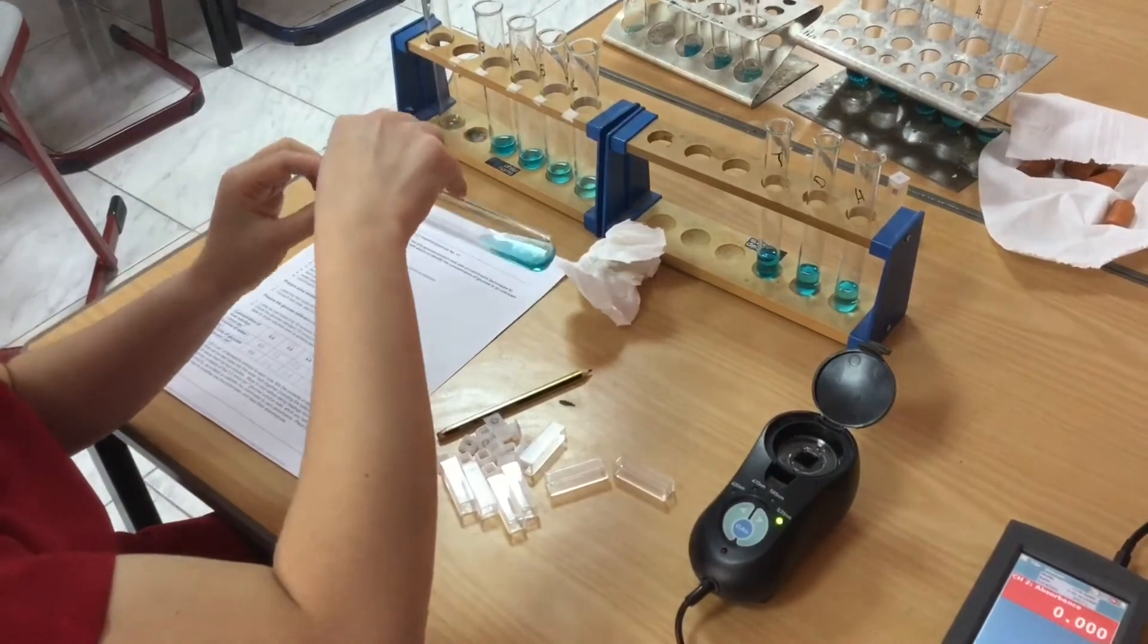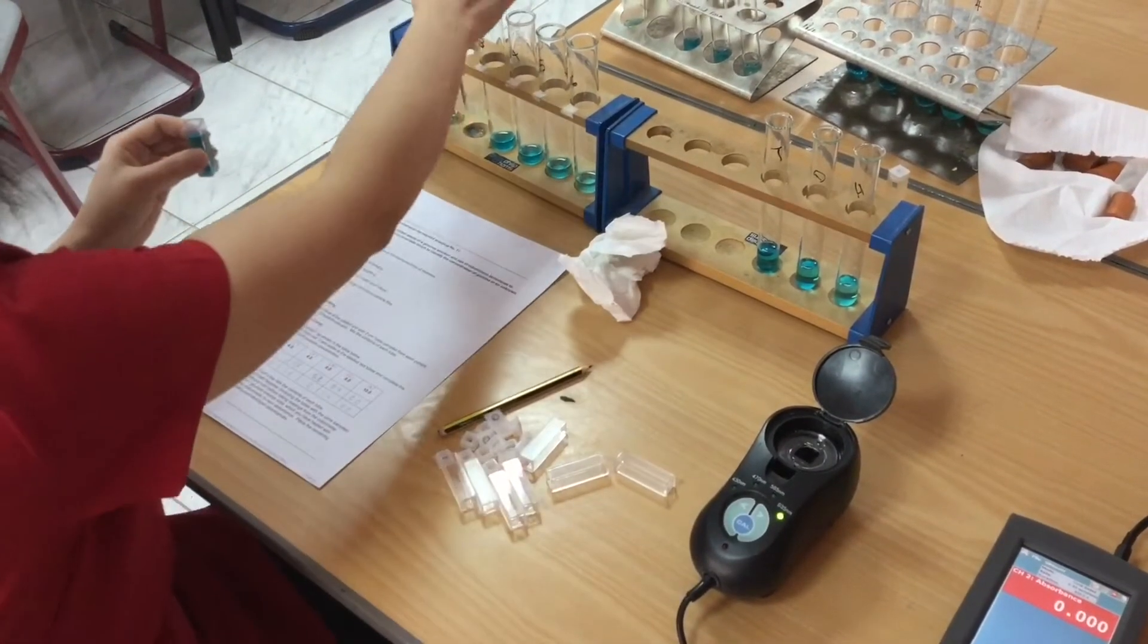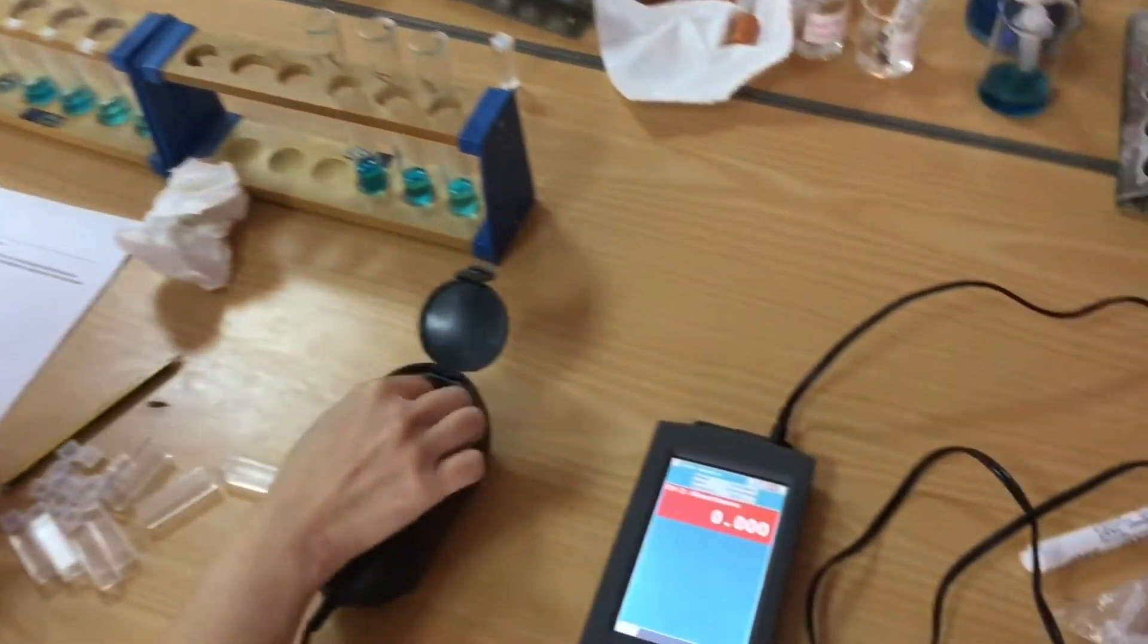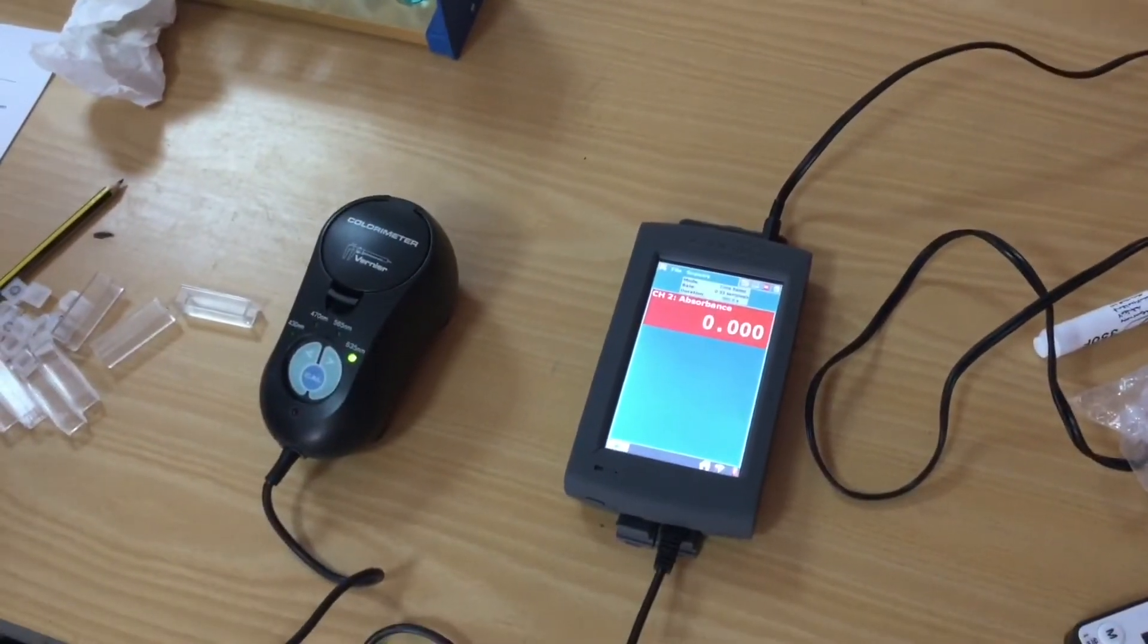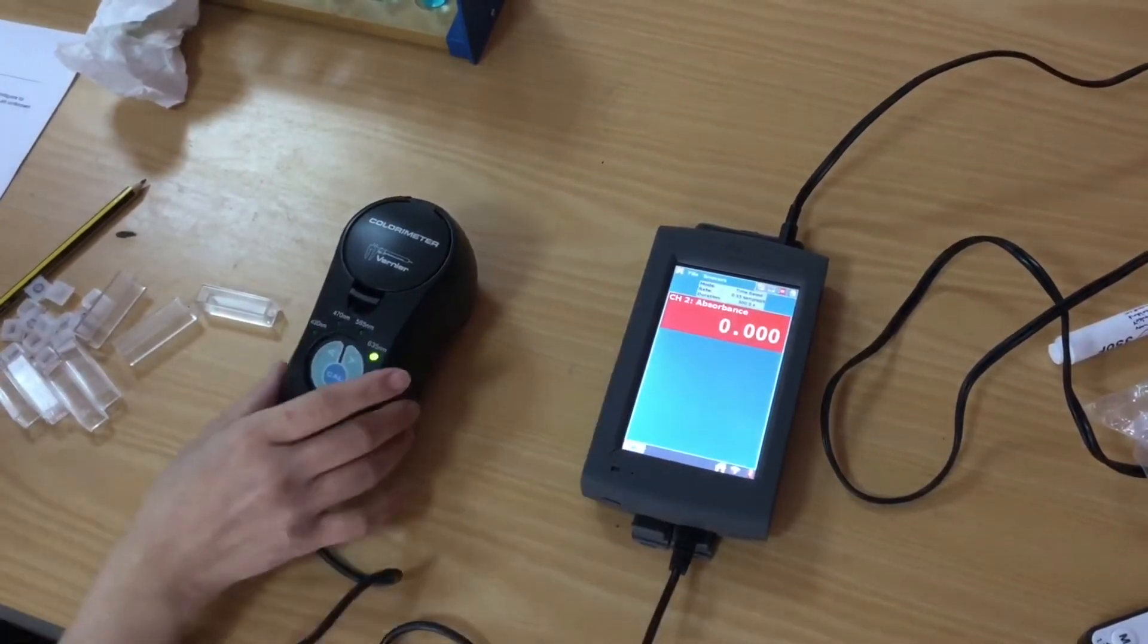So I then adjust my method and I calibrate using distilled water. I quickly see a pattern emerge and realize that these results make sense and calibrating with water is the way to go.